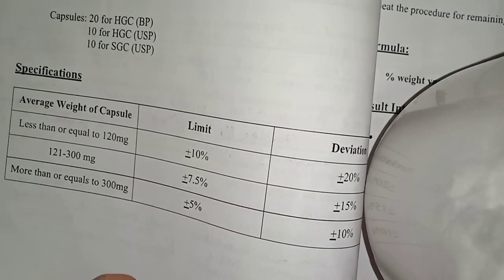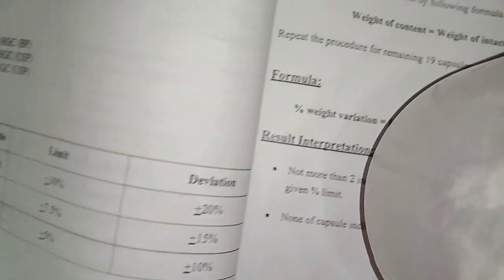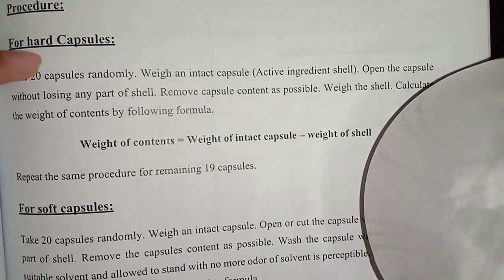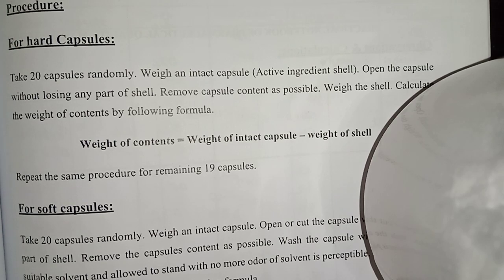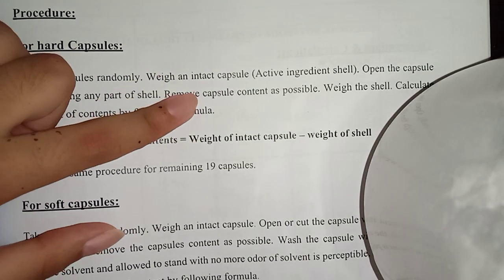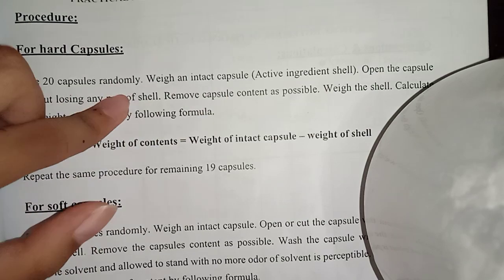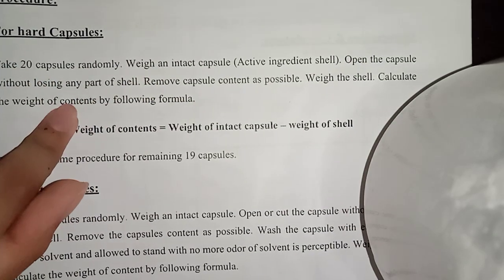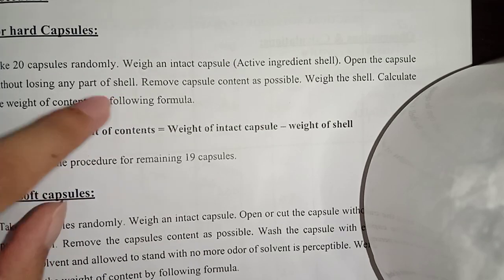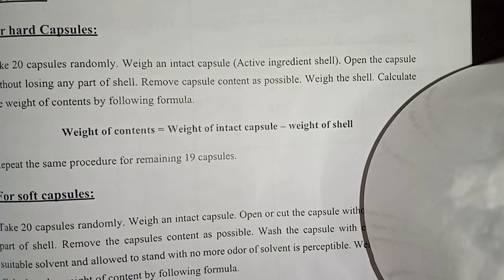The deviation allowed is according to the weight of the capsules. If you have hard capsules, you have to take 20 capsules randomly and weigh each capsule. Then open each capsule carefully without losing any part.